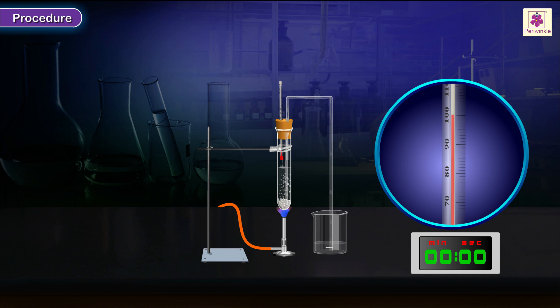Procedure. Stop heating after water has been boiling for about 3 to 5 minutes. Continue recording the readings.